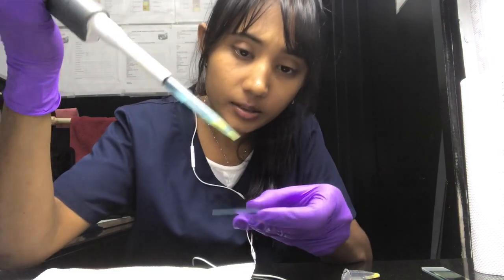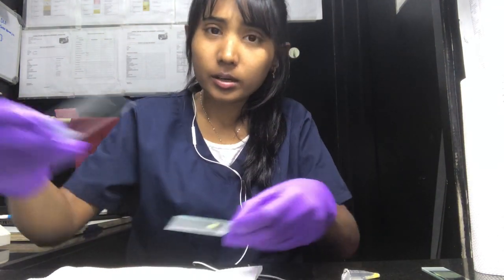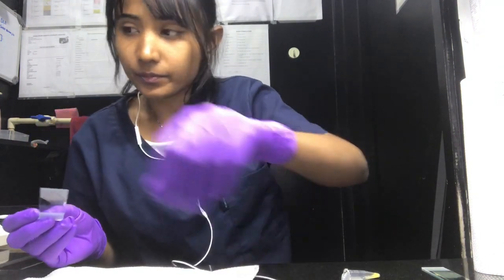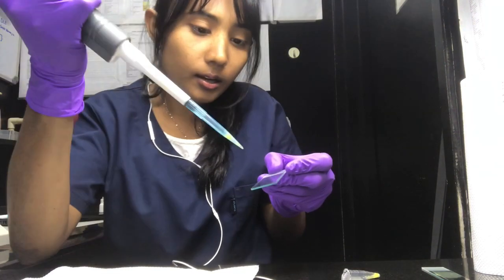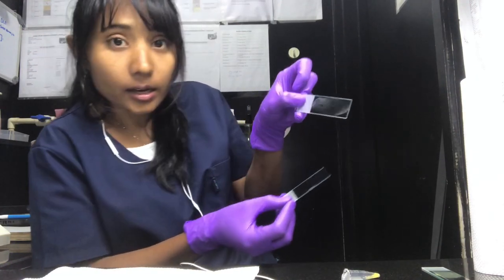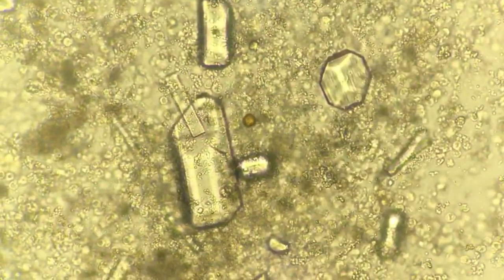For the stained preparation, I'm going to put one drop and make a clean smear. I'll take a clean slide, add a drop of urine, and spread it out. I think it's a decent smear, so let's do the sediment analysis first.